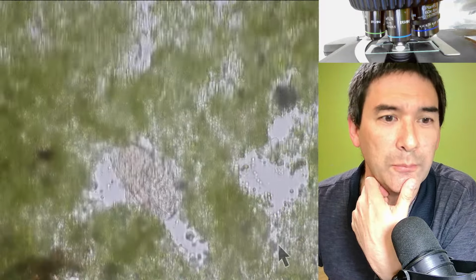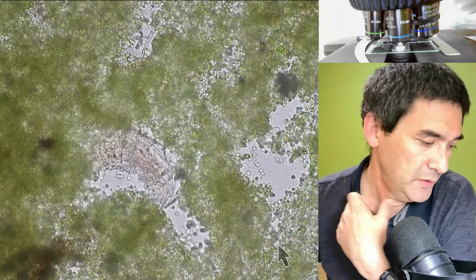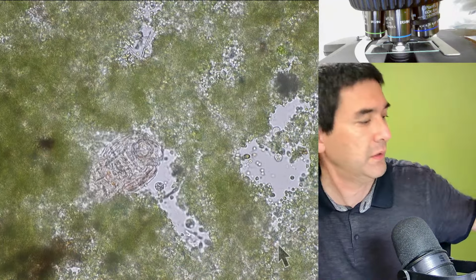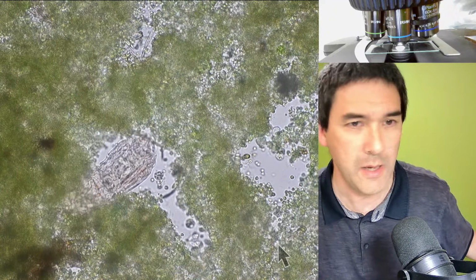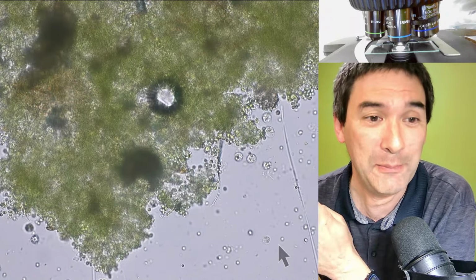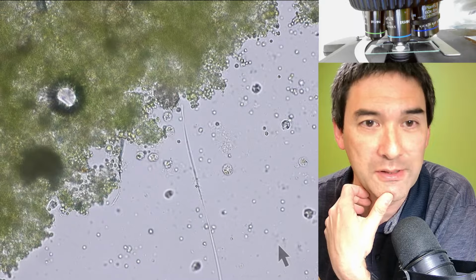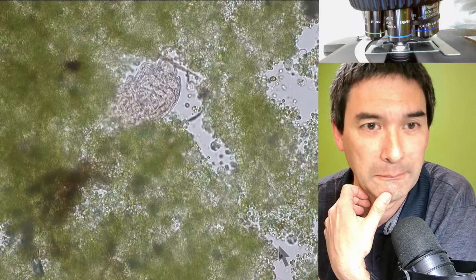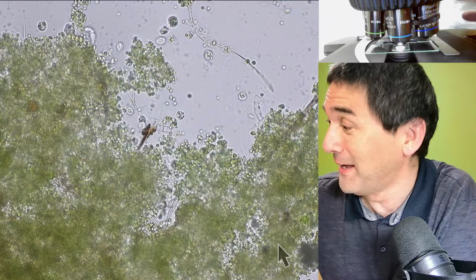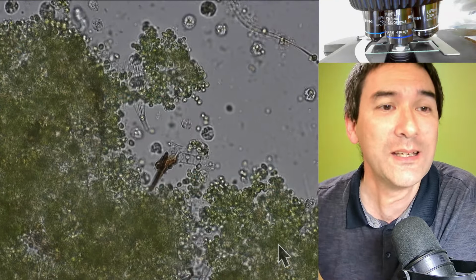I'm totally baffled, because this is a rotifer. It's not supposed to be in there. I mean, I used water from this water bottle over here. So maybe I got contaminated. It doesn't matter for the sake of our demonstrations. But I must have gotten some contaminants in here, because this is not okay. This is somewhat unexpected. But again, this is a little bit improvised. Okay, so 60 times.